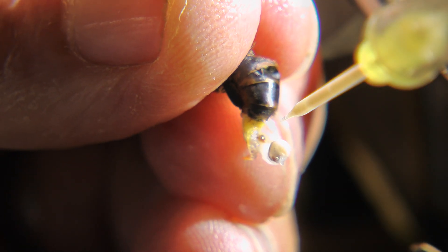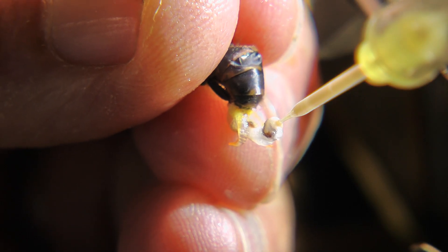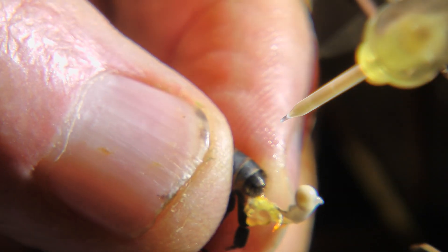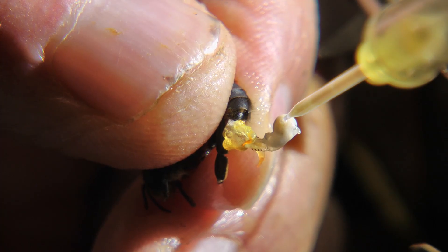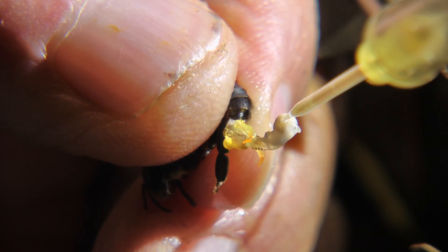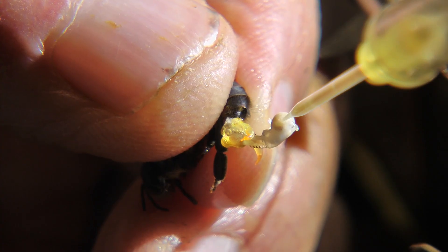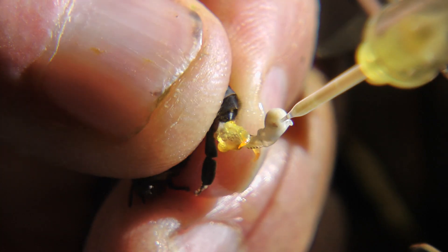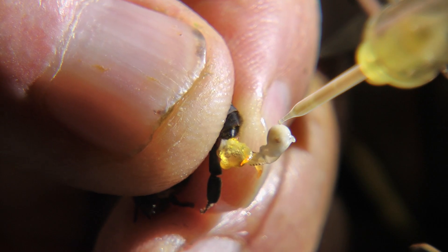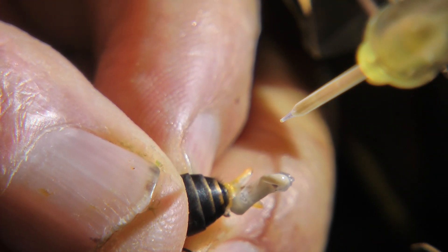I feel I'm starting to lose my concentration, getting more bubbles and stuff. I hear something flying around. I don't know what's going on here. I'm just not getting out a lot. Oh yeah, this is going to be a good one.